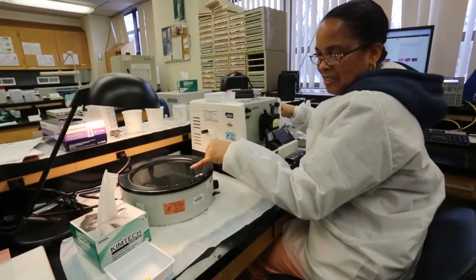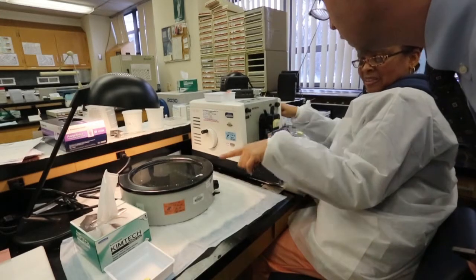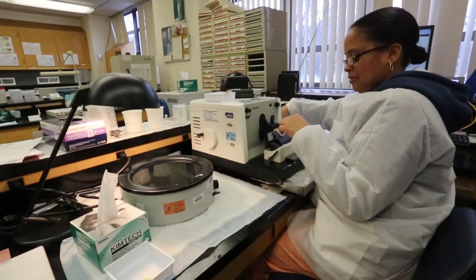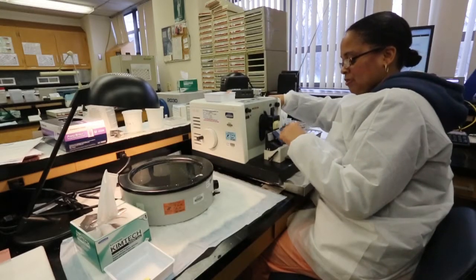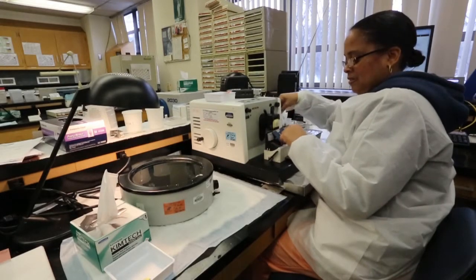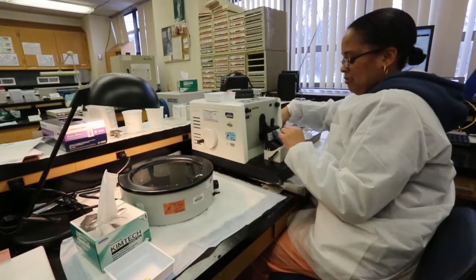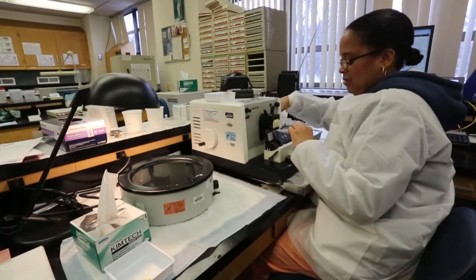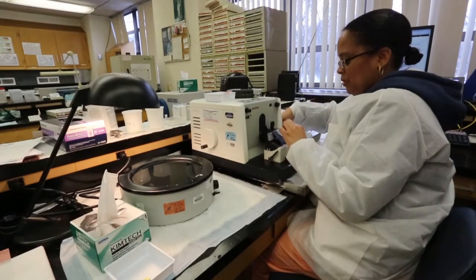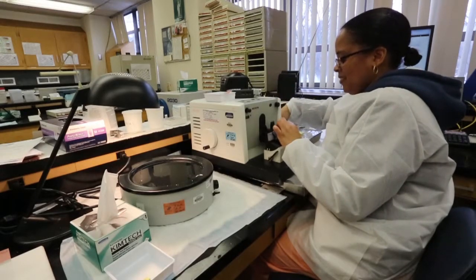See how I didn't get the full face? That's not a full face — see the difference? Then I would have to go in deeper. You can look while you're turning your wheel going in deeper — you can see when you get a full face. And to close up that little circle. At the same time you want to make sure you don't cut through the entire tissue — you don't want to end up with nothing left.